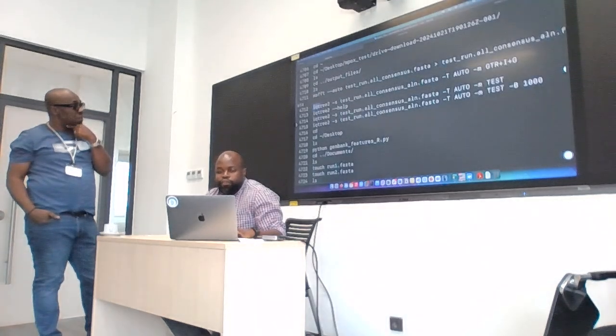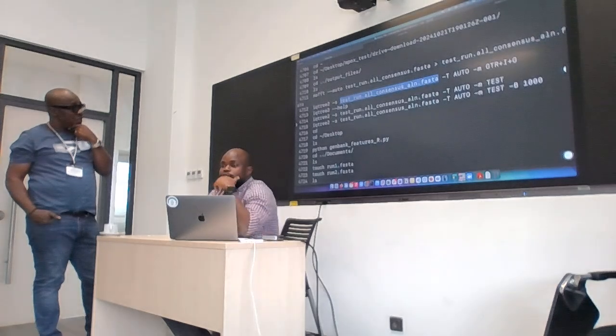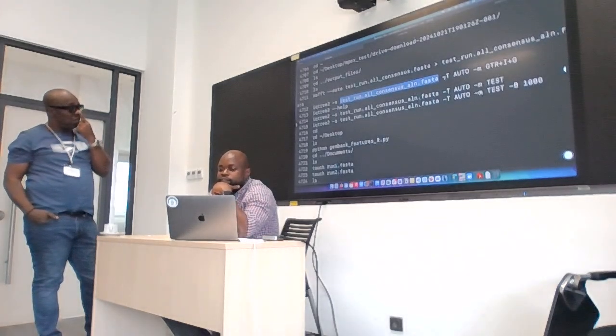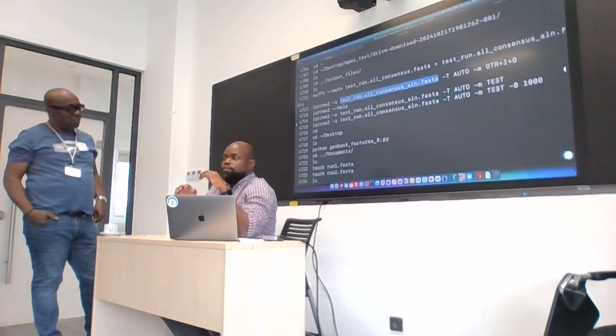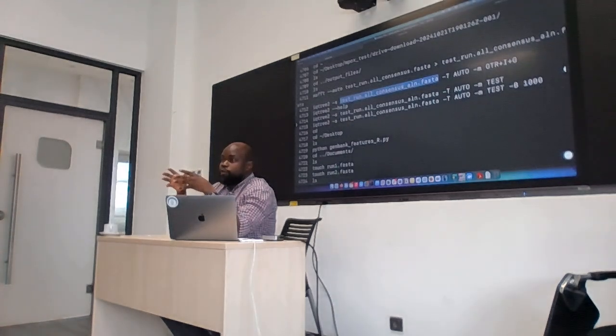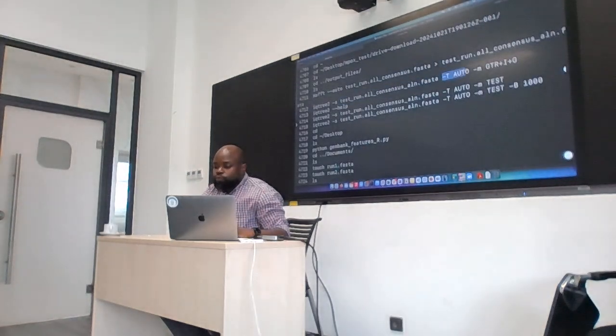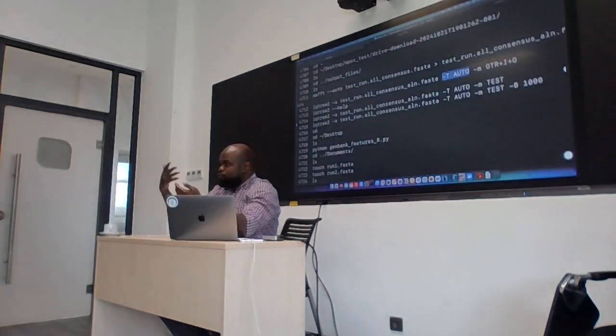So for IQ-TREE, you need to give it an input -s. So this is your alignment file. In this case, my alignment file is this one. Now there is the option for -T. This is for threads. Your computer has a given number of CPUs, right? A lot of bioinformatics analysis is very computer intensive. It can decide to use all the CPUs on your system. So you can sometimes instruct it to use a given number of CPUs, or just use whatever it finds. In this case, we are going to use auto, which means it will just determine the best number of CPUs to use.